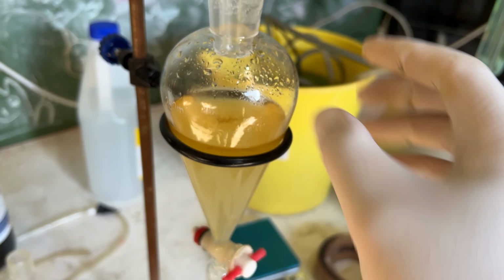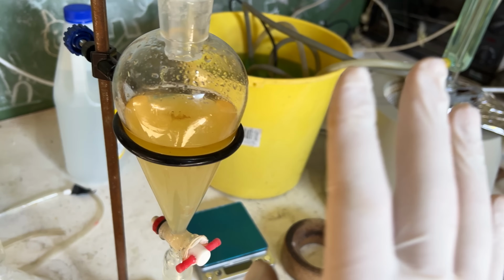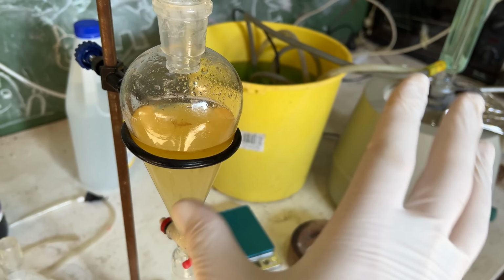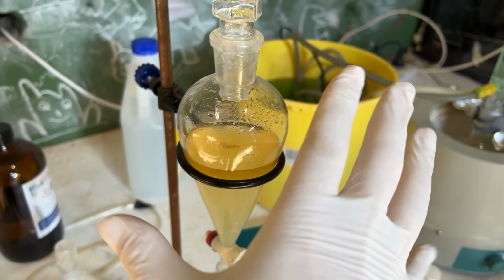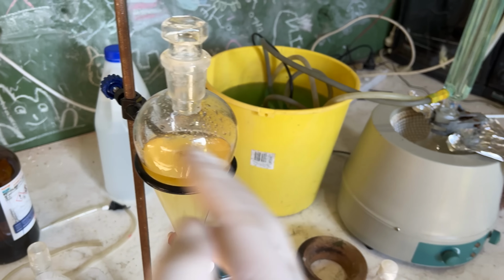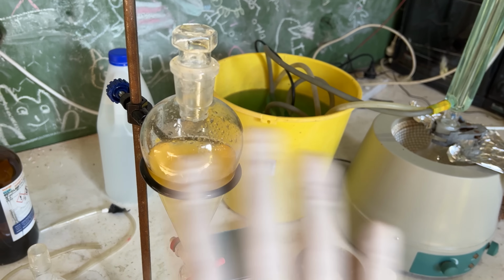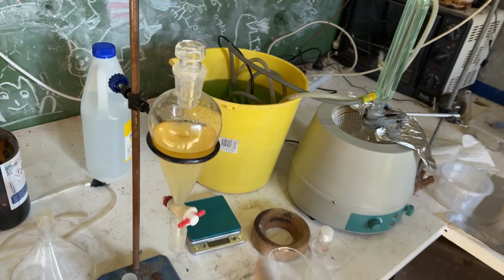So I'm just going to do a couple of extractions with ethyl acetate and then drive off all the ethyl acetate, in the same way I've been doing it with the dichloromethane. And then hopefully that leaves us with more of an actual solid residue than we've been collecting from evaporating off the dichloromethane, because I'm getting nothing at all. But this looks much more promising, so I'm just going to do that right now.